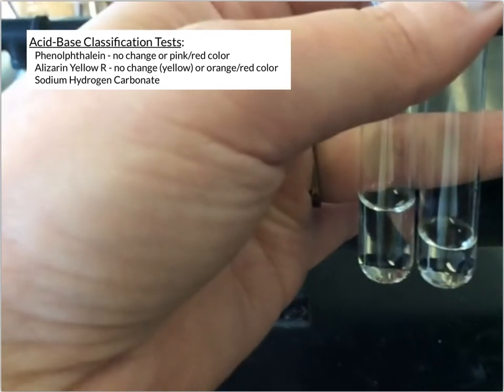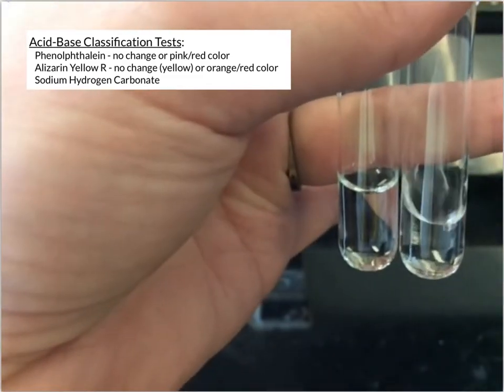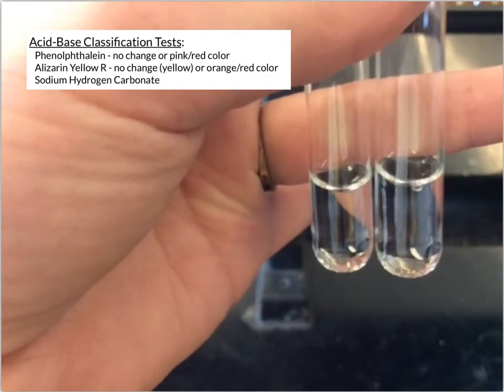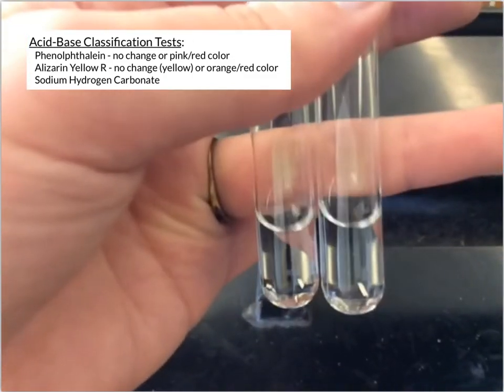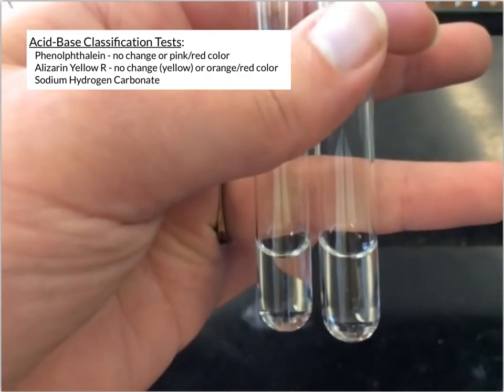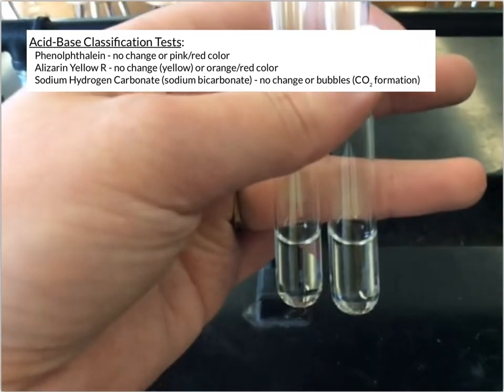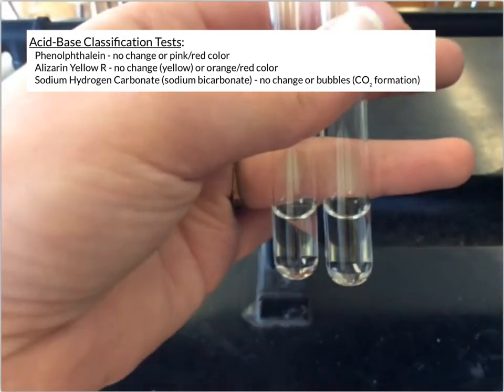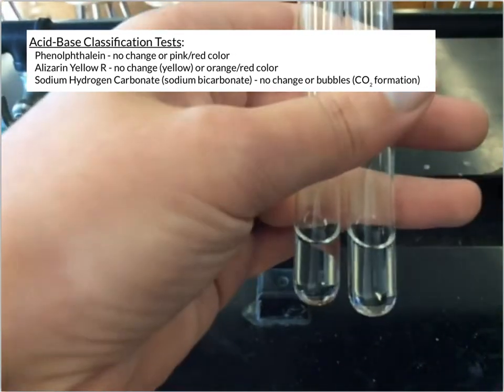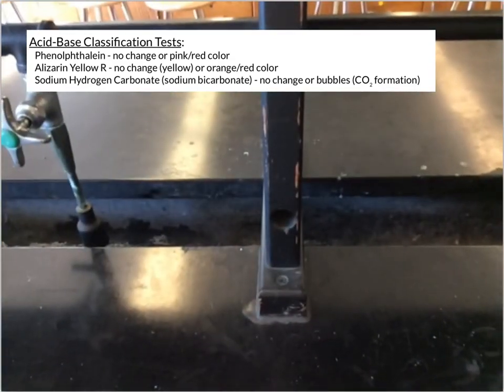And then if I do it to the tube on the right, now this one you can kind of see a little bit of swirling there. That's just mixing of the different densities, but there weren't ever any bubbles forming in that one. So those are kind of your 2 results for when we add a bicarbonate solution to something. It'll either not react or it'll form those bubbles, forming CO2 gas.